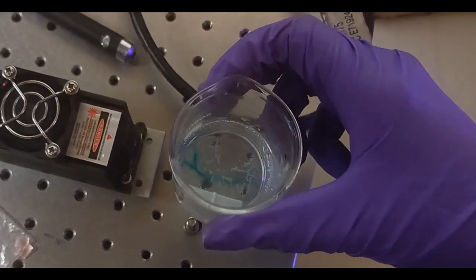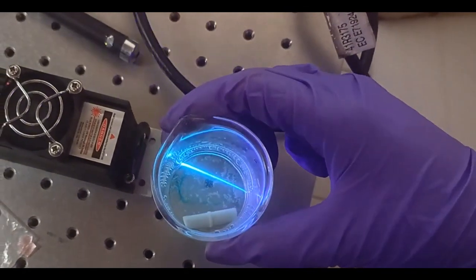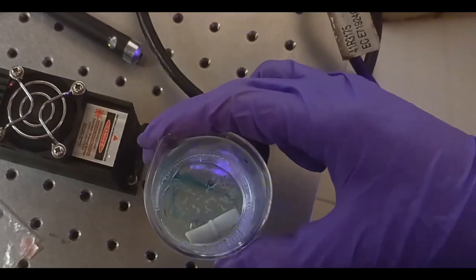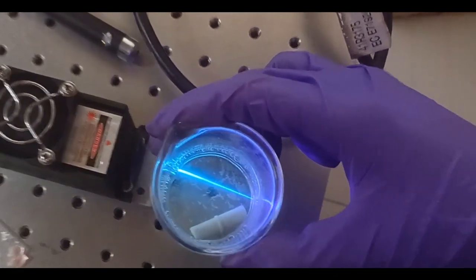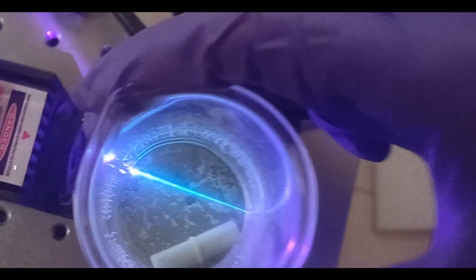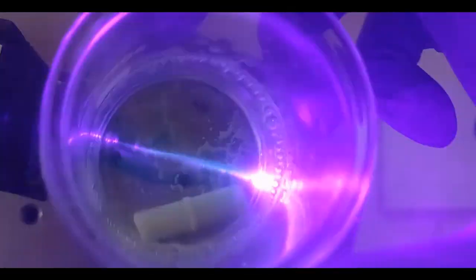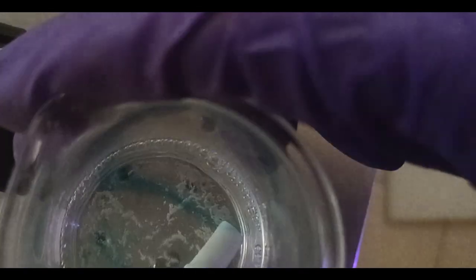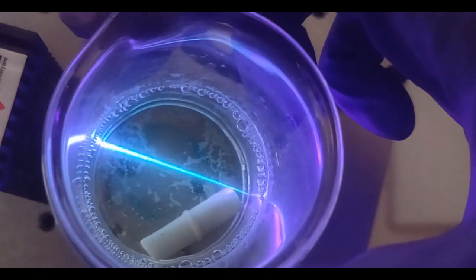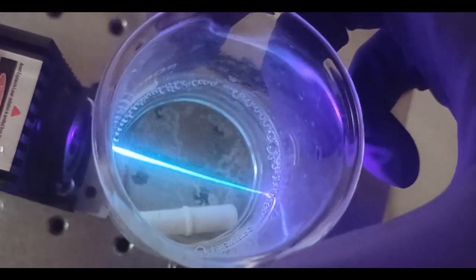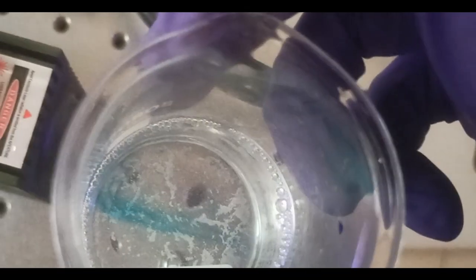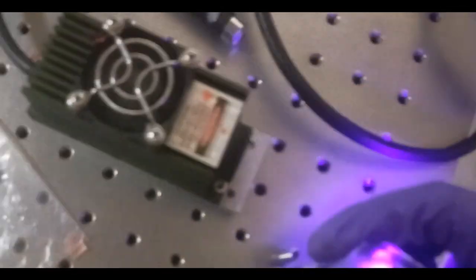When methylene blue is mixed with tin chloride and HCl, it is reducing the methylene blue to its colorless form unless we are irradiating with the 405 nanometer laser. The 405 nanometer laser gives energy to the methylene blue to get oxidized again. For a temporary brief period we can see the blue color solution, but that blue color is temporary because again the methylene blue is reduced by the tin chloride in the solution and it forms a colorless form.